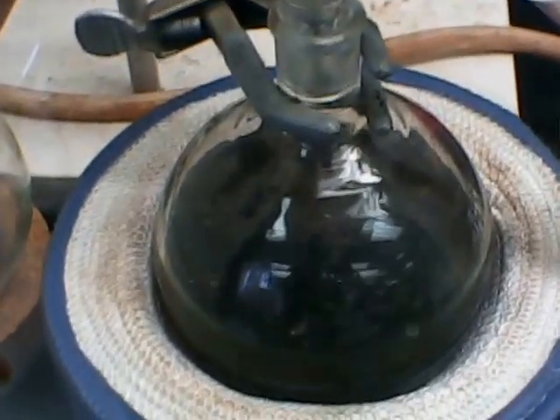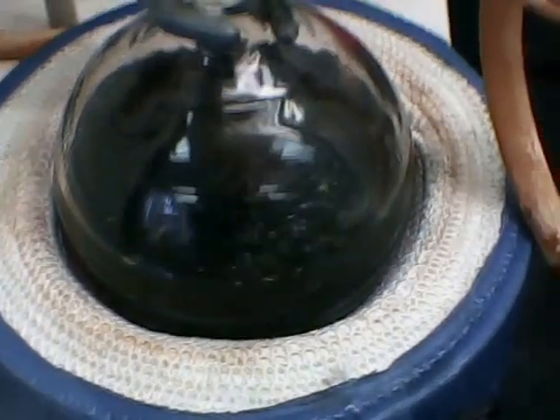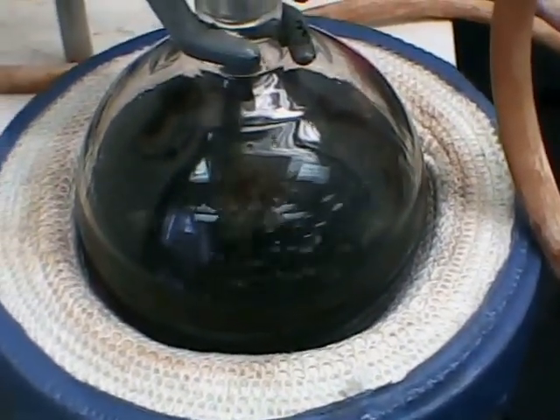Yeah, so it's coming over pretty good now. About 45 degrees. And that's what the drip gas looks like. It's brownish.